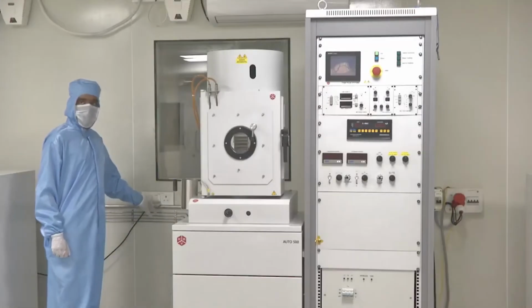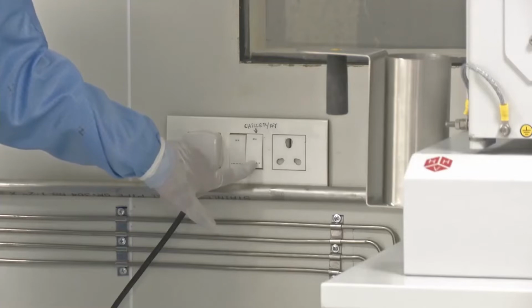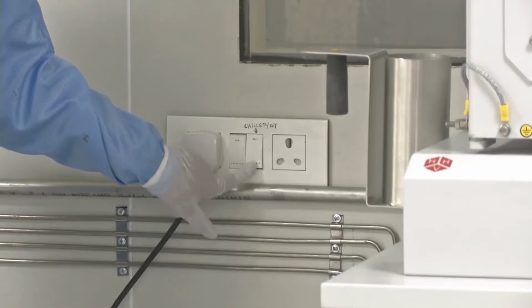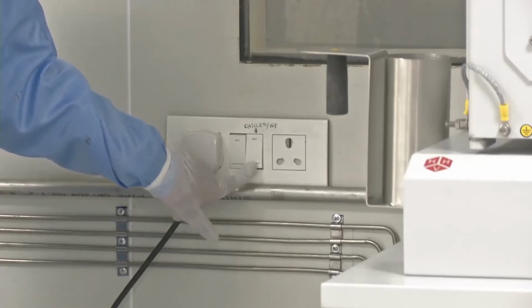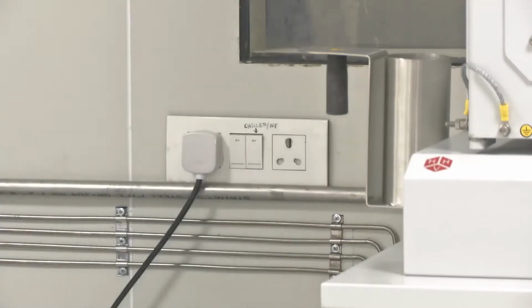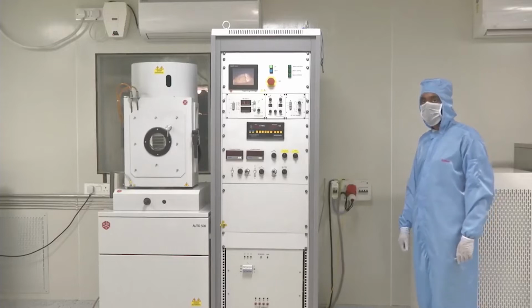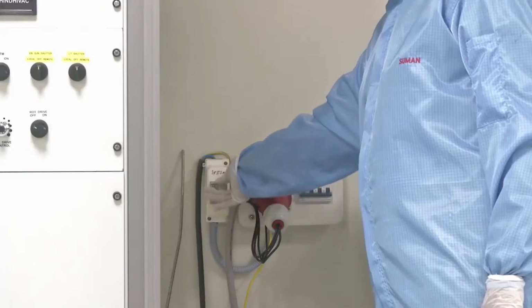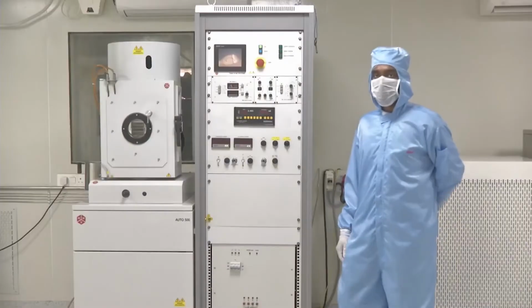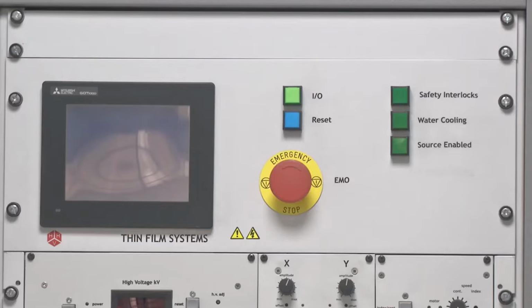The first step while starting the electron beam evaporation system is to switch on the chiller. Chiller, as the word suggests, is a unit that supplies cooled water, typically around 18 degrees Celsius, to the system, which supports the crucible, which we will later see, to remain cool. After turning on the chiller unit, the next step is to switch on the main switch of the electron beam evaporator. After that, we will turn on the system and its display unit.